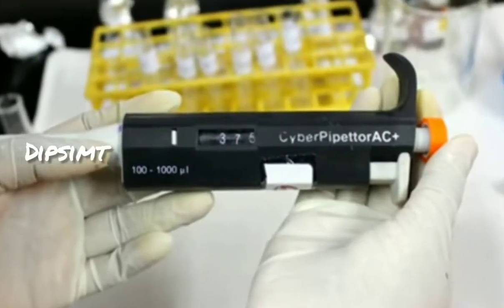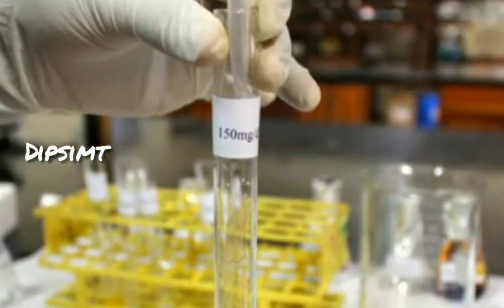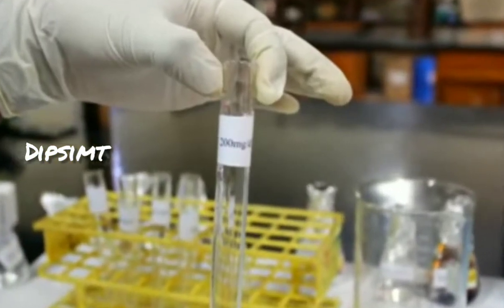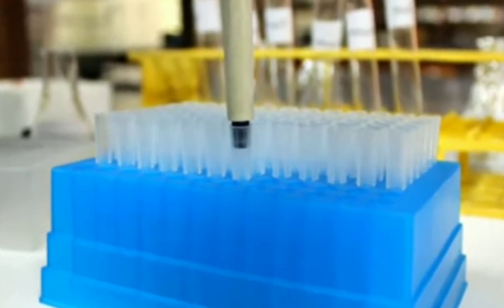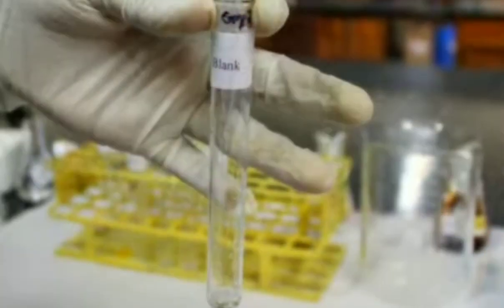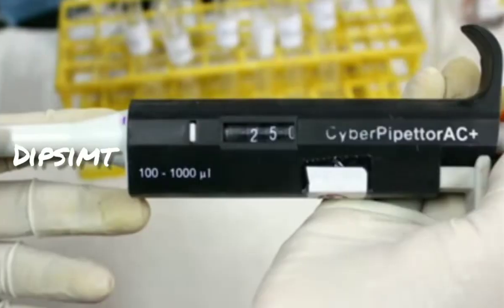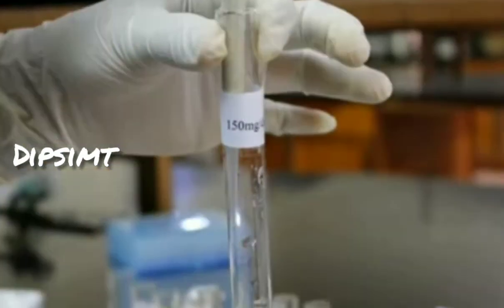Transfer 375 microliter of glucose standard solution to the third test tube labeled as 150 mg per deciliter, and 500 microliters of glucose standard solution to the fourth tube, which is labeled as 200 mg per deciliter. Now insert a fresh tip to the micropipette and transfer 500 microliter of distilled water to a test tube labeled as blank. In the same way, add 375 microliters of distilled water to the first test tube, 250 microliter to the second tube, and 125 microliters to the third tube.